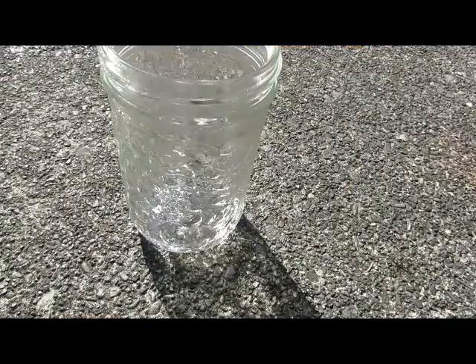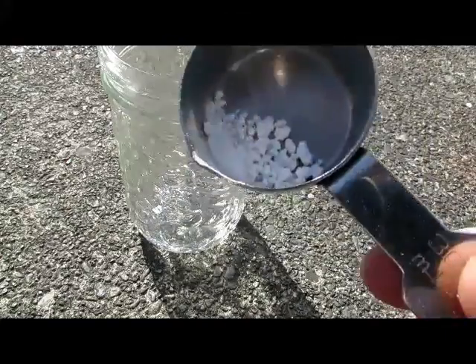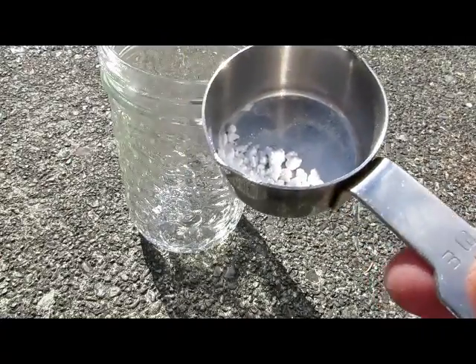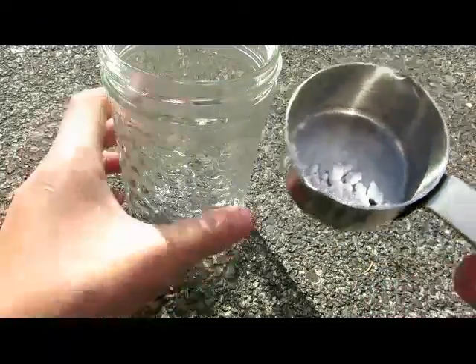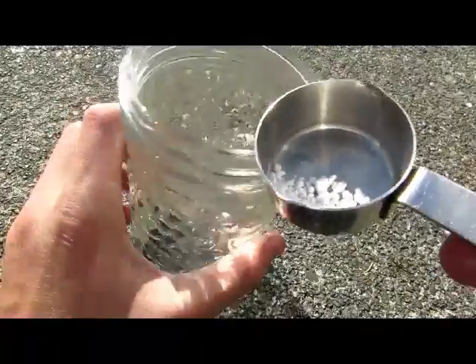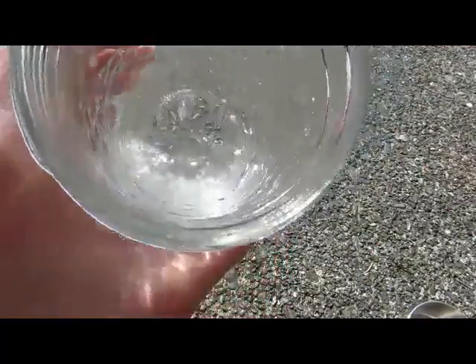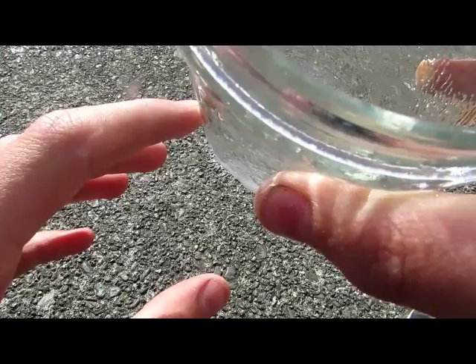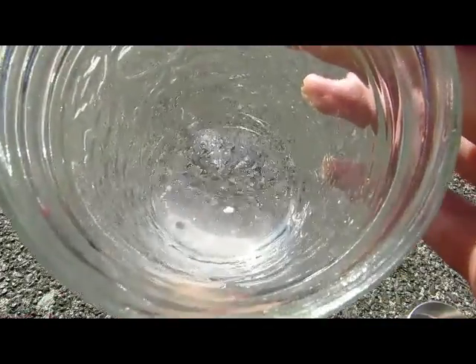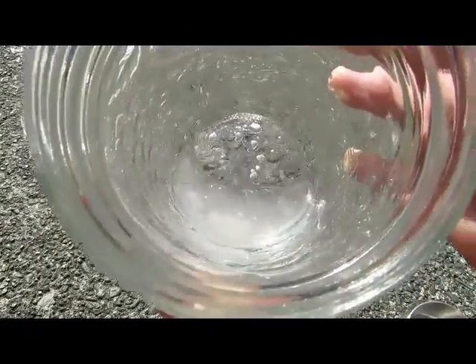Now we take what we've got, which is hopefully our lithium carbonate. The bigger chunks might still be some lithium peroxide, as they're not finely ground and may have only reacted on the surface. We take another container of water and dump it all in — and it doesn't look very soluble. There might be a few bubbles from the larger chunks, but mostly it's remaining insoluble.